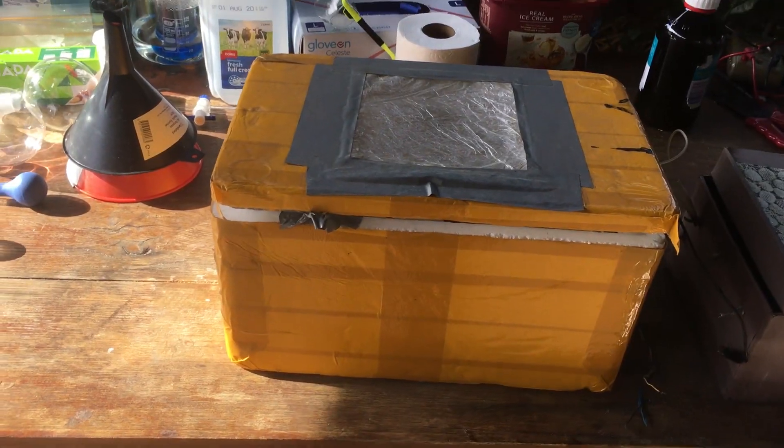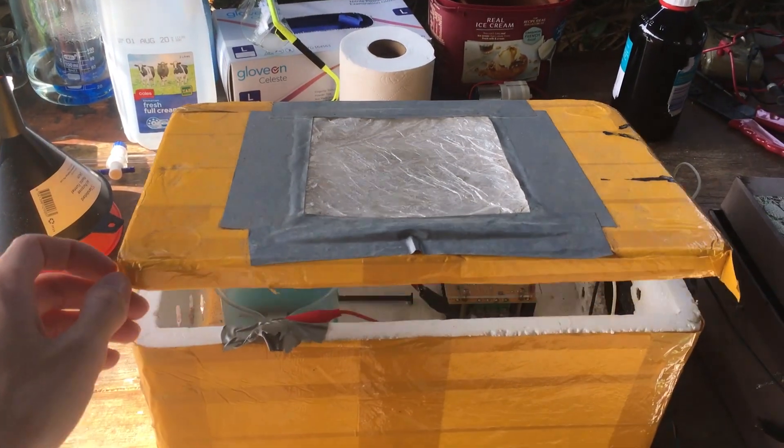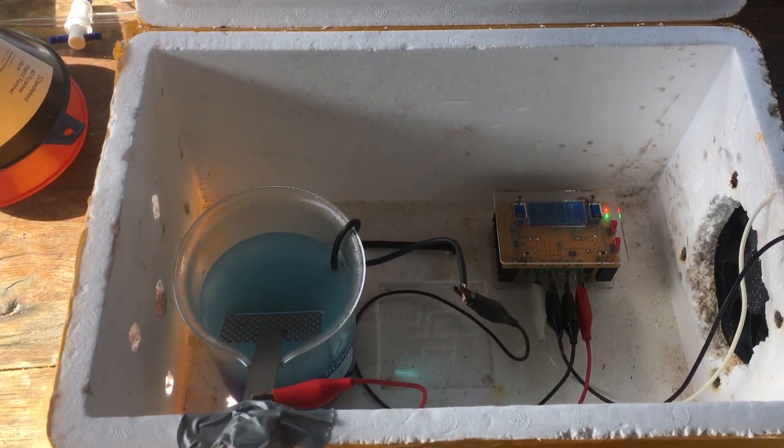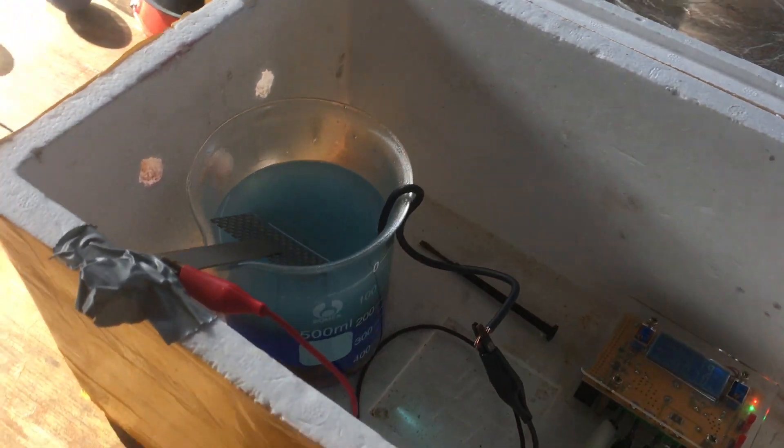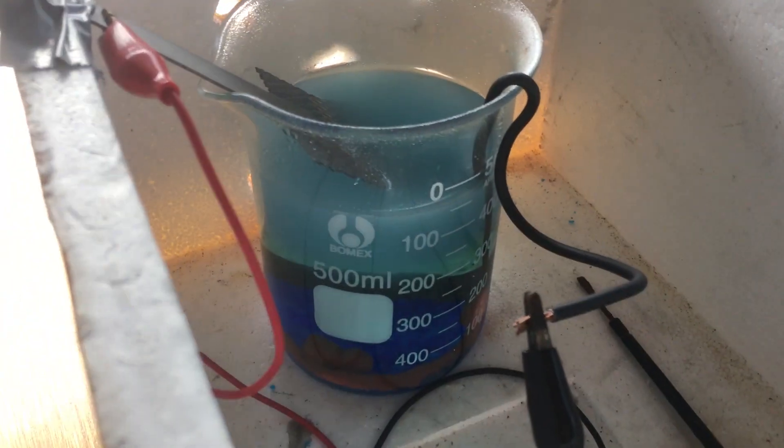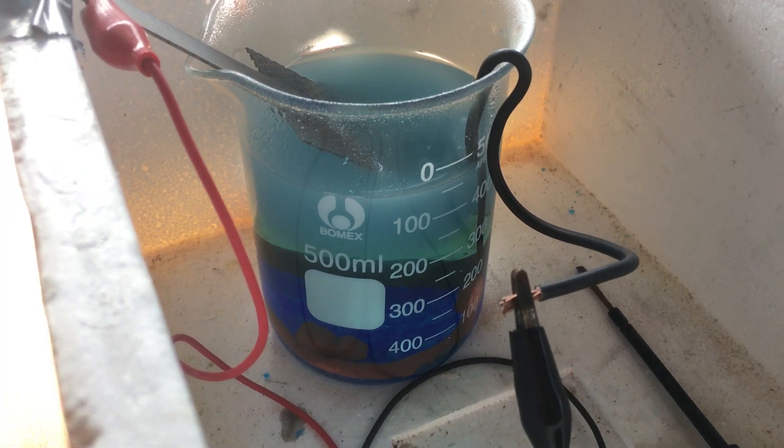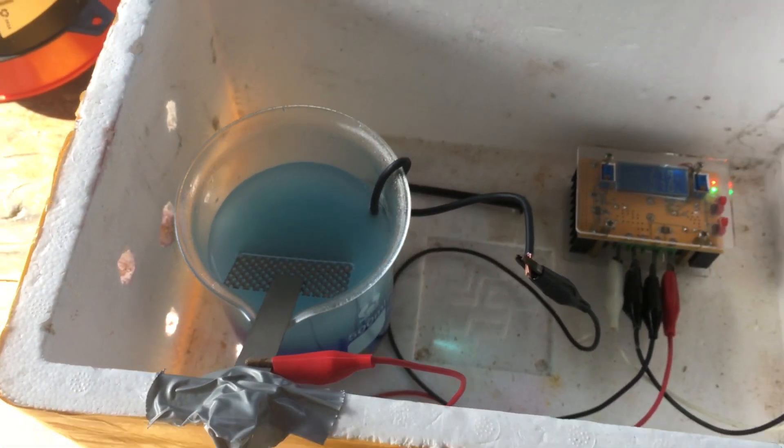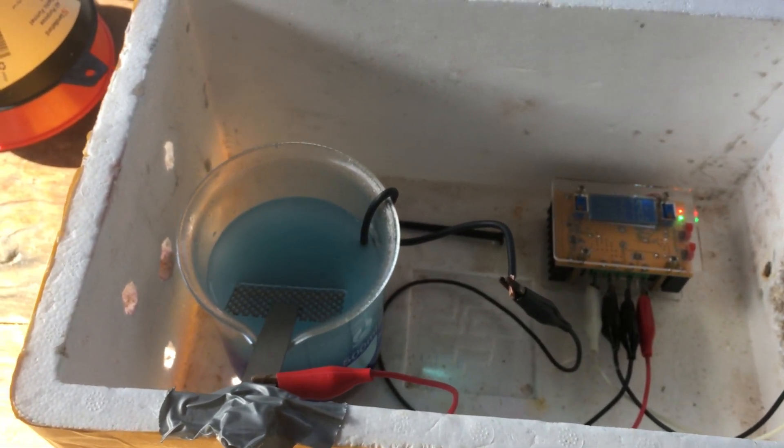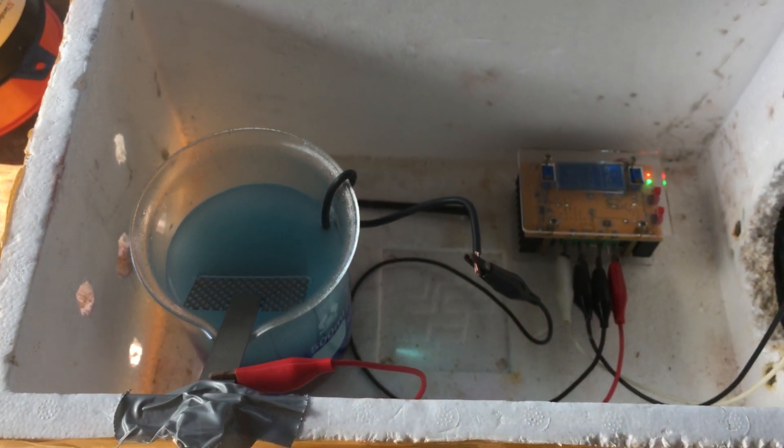It's going to be useful for a couple of reasons. We'll start with this example right here. What I'm doing is just simple electrolysis of a copper sulfate solution with a platinum anode and a copper cathode in order to generate sulfuric acid.